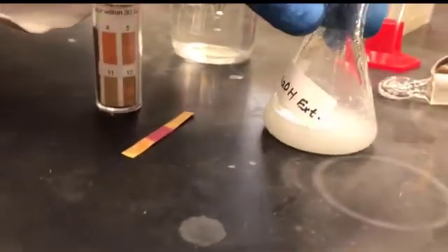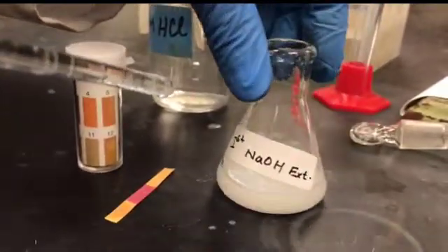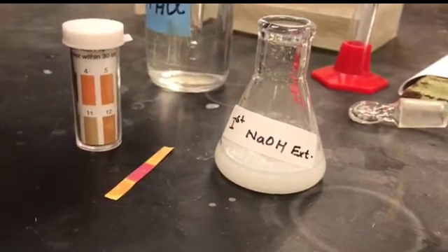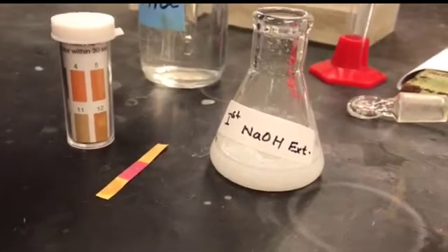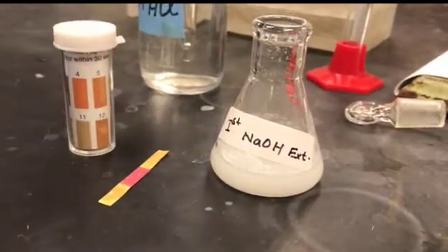Right? So now you need to figure out what this precipitate is. I already mentioned, when I was talking about the flow chart, the process of separation of the acidic impurity. So from that, you would get a hint of what this is.